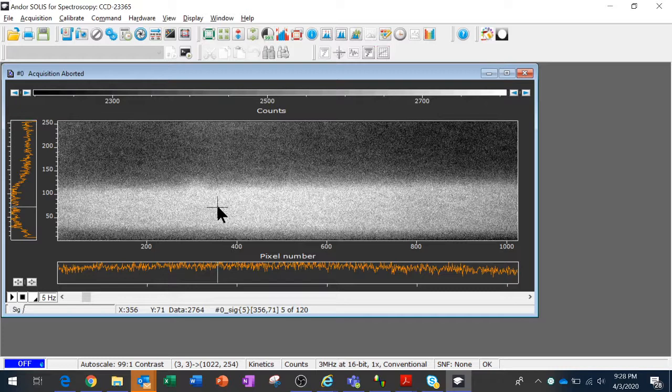So as you can imagine, this causes a problem trying to measure a small signal. Not only are we losing some of our dynamic range, because we were already carrying a few extra thousand pointless counts, but the variance, both spatially across the sensor and temporally, that is to say measurement to measurement, the noise from that is going to cause problems if I'm trying to measure a small signal, because that small signal will be lost in the noise. So I need to cool this camera. I need to turn the thermoelectric cooling on before I'm going to do any kind of serious measurement.